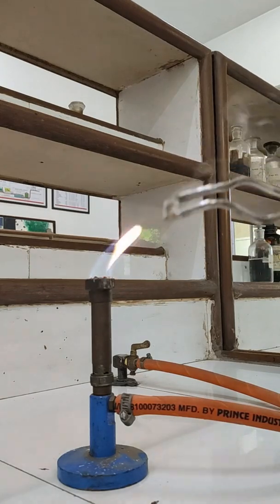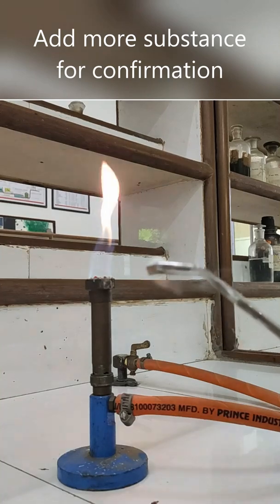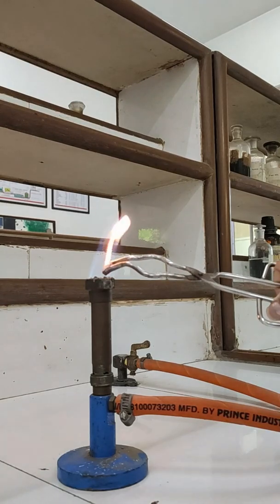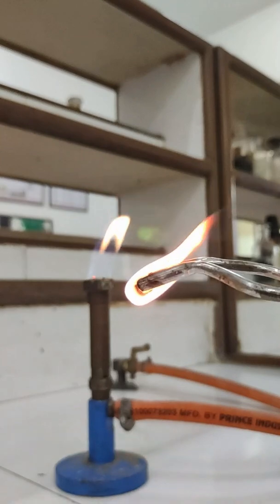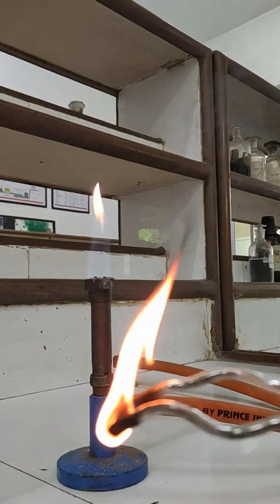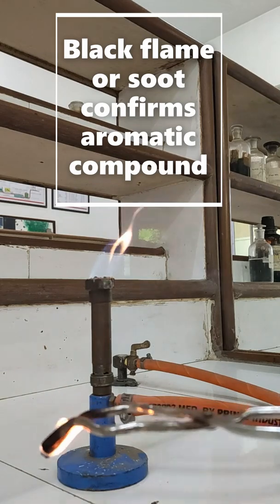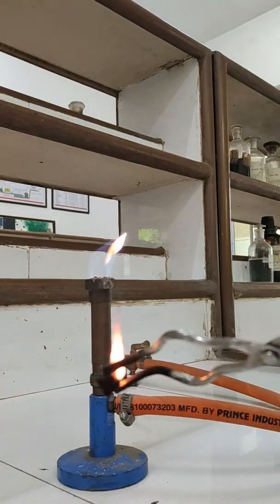Now here you can see it is black, so what I can infer is it could be aromatic. To check, I will add more of the compound and allow it to burn. Since the compound is in excess, it will burn easily — and look how interesting this is. It is giving you a clear-cut black sooty flame, and that confirms the presence of an aromatic compound. The carbon sooty flame is quite visible.